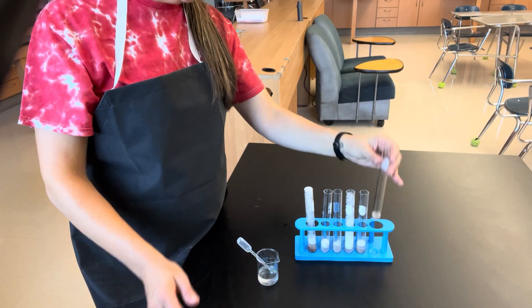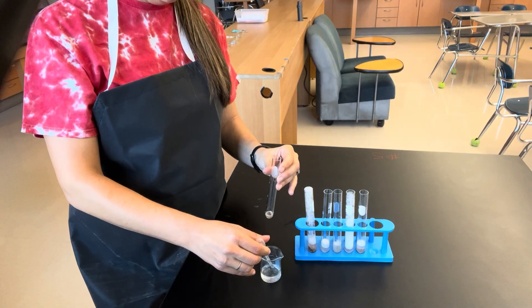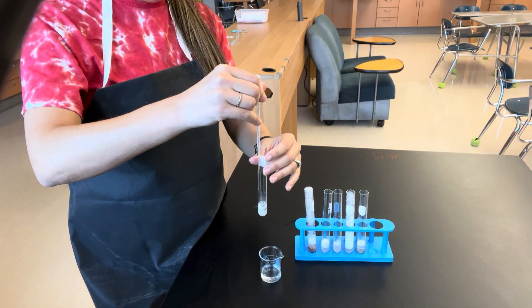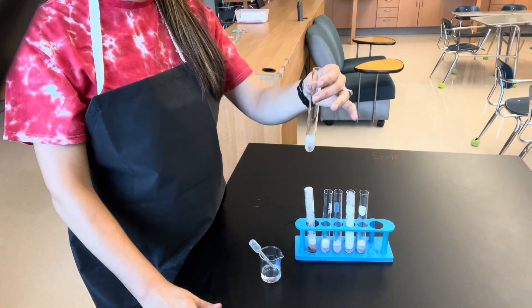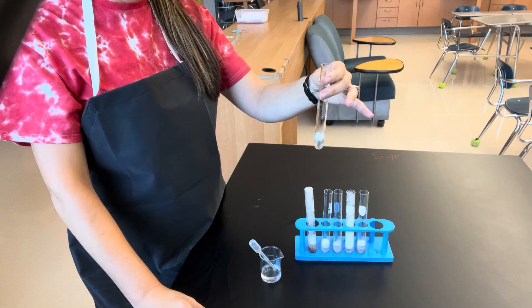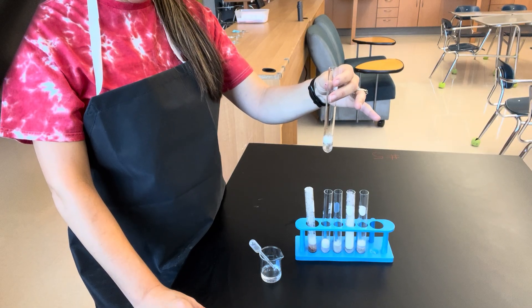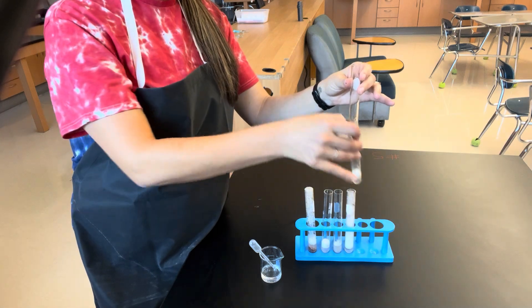And lastly, we're going to do high pH — liver that has been soaked in a base. Once again, a little bit of a reaction.